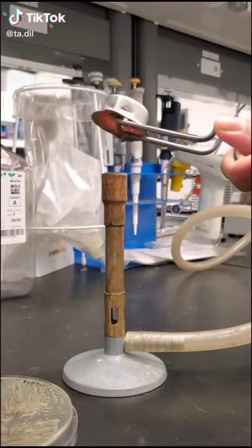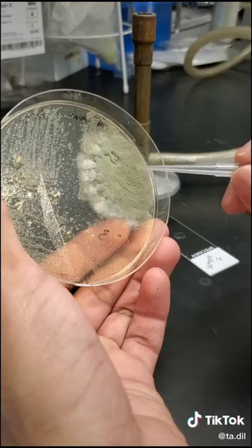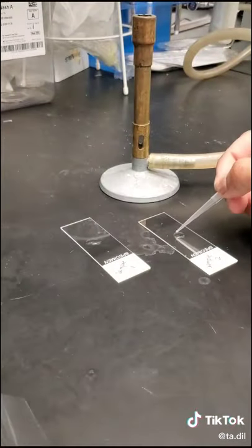Today I'm isolating some fungus I found growing in our cold room and I'm going to look at it under a microscope. My first sample was green in color, looked a bit powdery, and formed a carpet over the petri dish it was growing on.